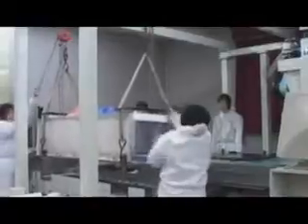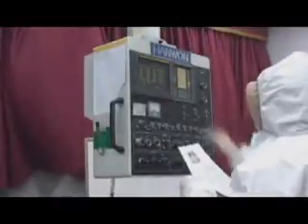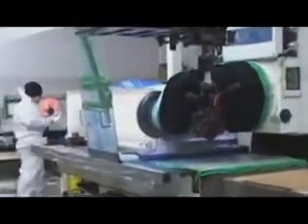I put the box on the cutting machine and tightly fasten it. This is a special machine designed to consecutively cut the cadaver. I cut the box into thin slices using the machine. Normally, I cut them to be 0.2 millimeters thick.